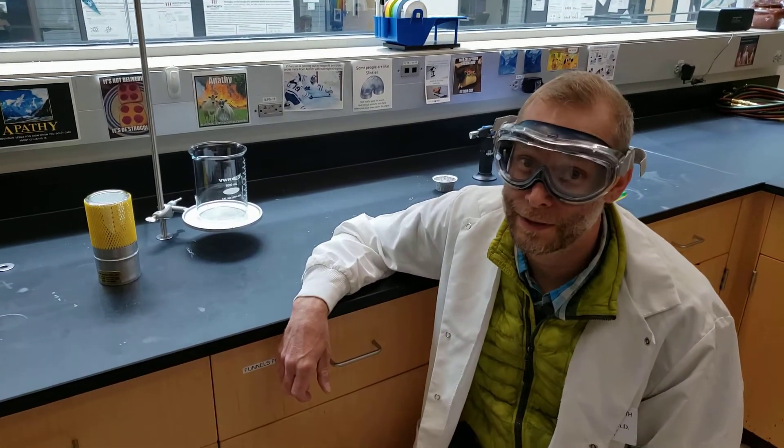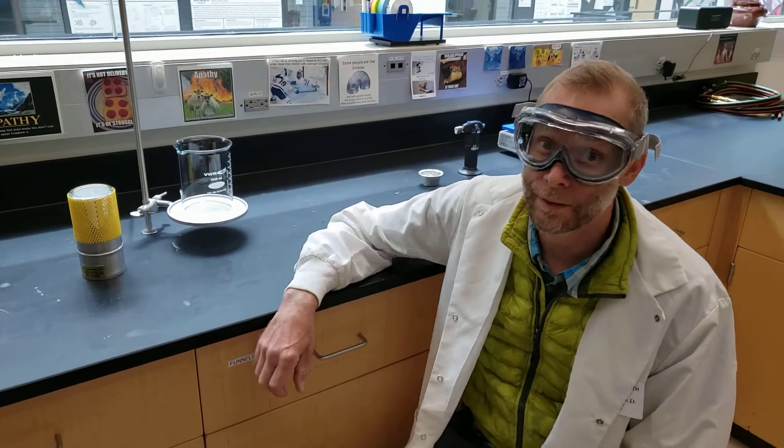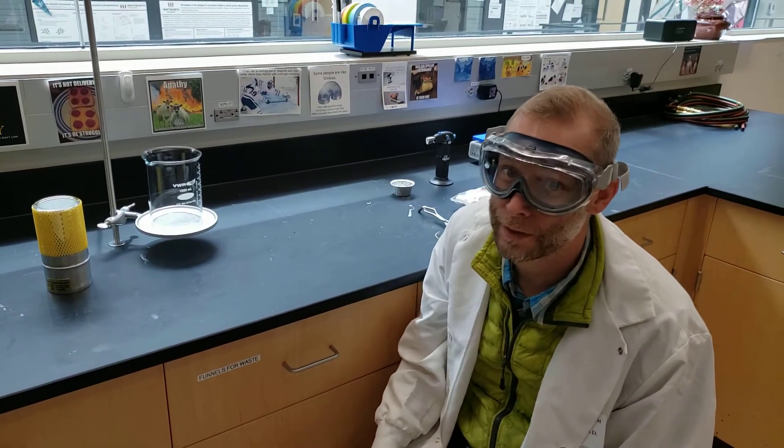Hello, this is Dr. Wiley in the chemistry lab and today we're going to burn a marshmallow in liquid oxygen.